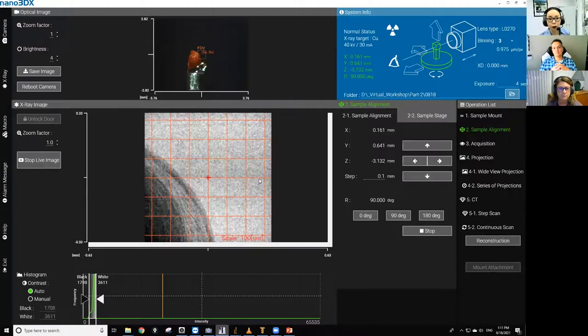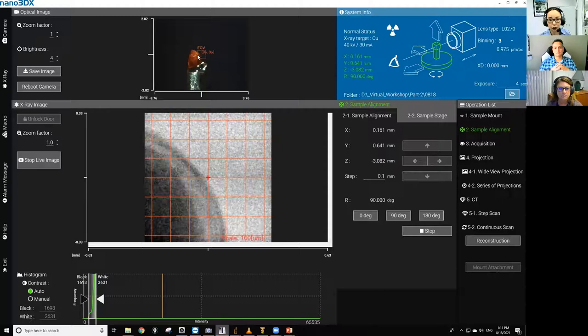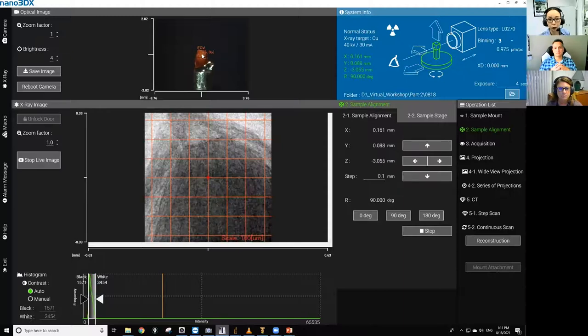So what I'm doing now is to click the spot I want to bring to the center of the view. And this little red square is the field of view, which is about 0.7 millimeter with the 20x lens we're using today.